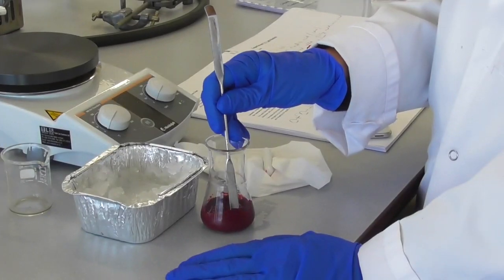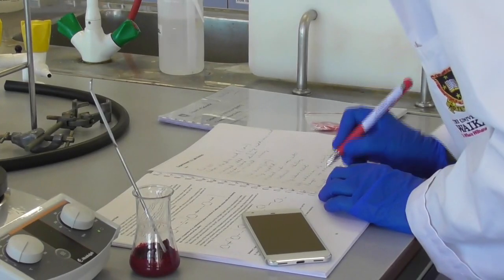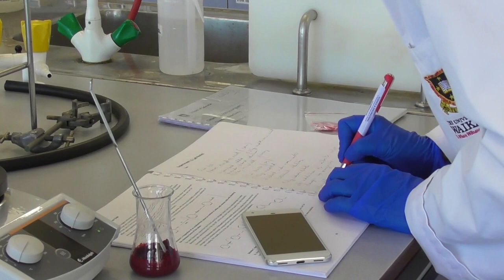After that I let the flask sit on the bench with occasional stirring to let it come to room temperature. I make note of all observations.